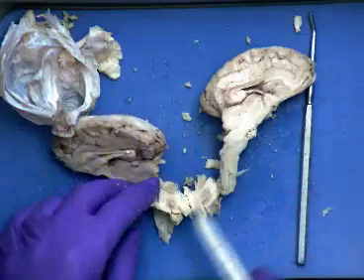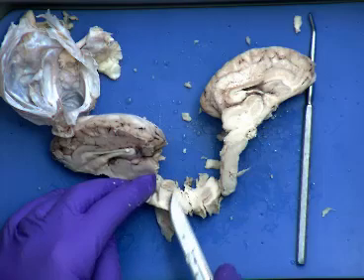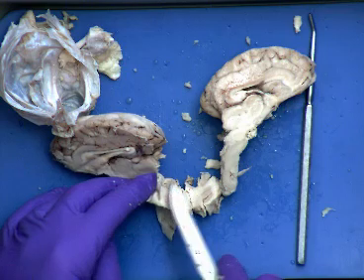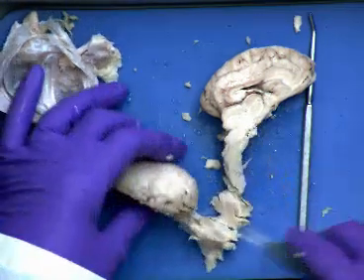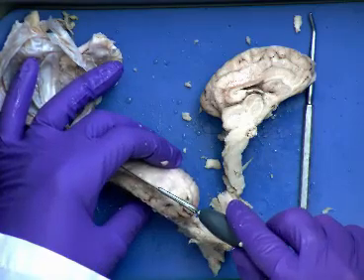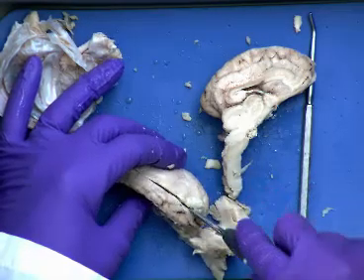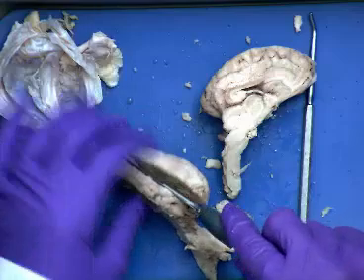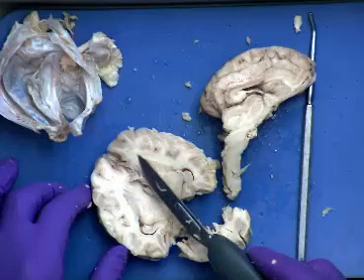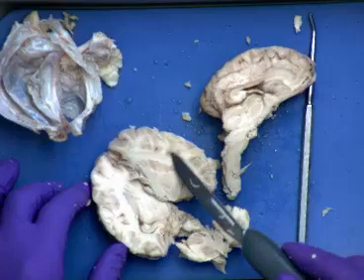So you can see a little bit. See how it's dark here and it's light there? So that's part of that arbor vitae that we were seeing. So myelinated neurons through the white matter, unmyelinated neurons in the gray matter. You can also see that in the cerebrum. So if we do a parasagittal cut, right, mid-sagittal right through there, or just a sagittal cut that goes in parallel with it like this, then what you're going to be able to see is, again, the pattern of gray matter on the outside and then white matter on the inside. So those are where the myelinated areas are versus the unmyelinated neurons and axons there.